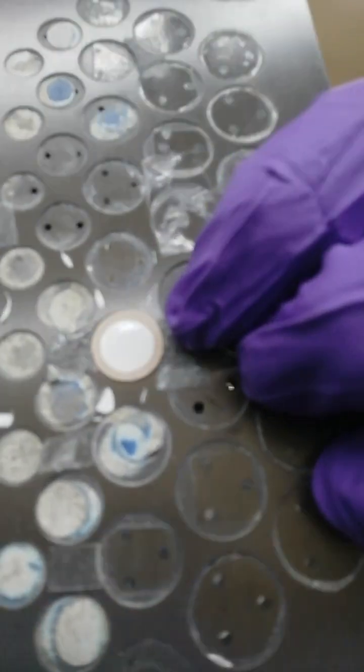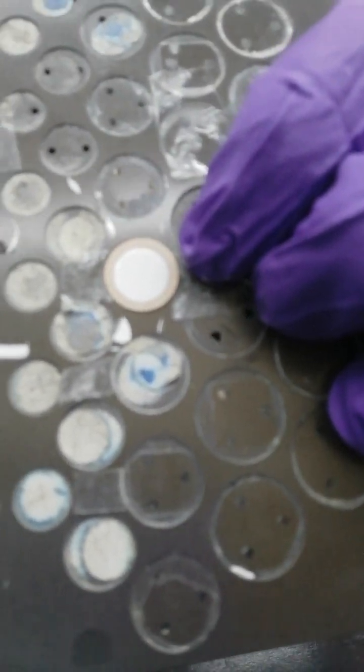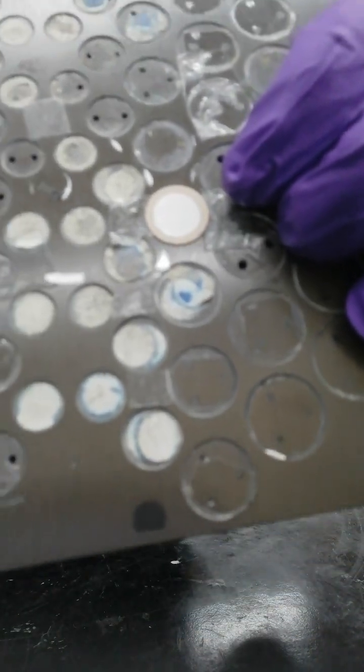This is screen printed now with our electrolyte for SOC.